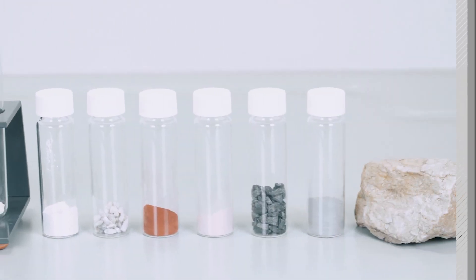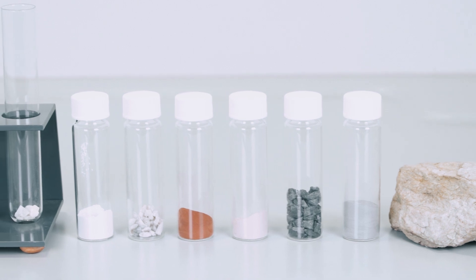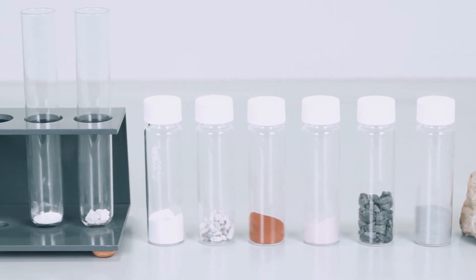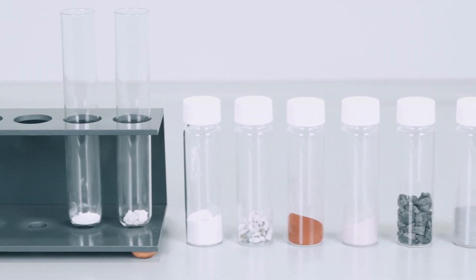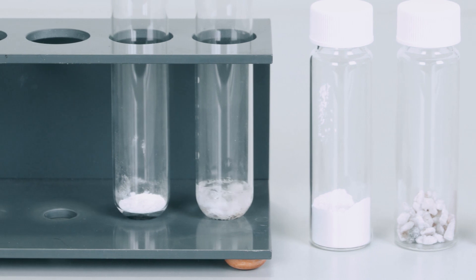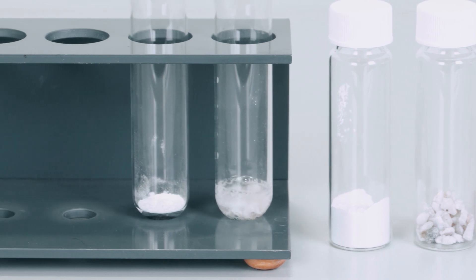Stones have to be ground down for digestion so they can be analyzed. The finer the sample, the better it works.